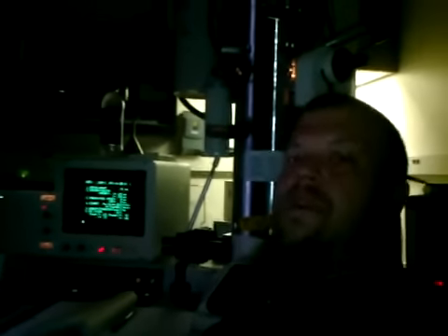So I thought I'd show people some of what it looks like for me at the other place. I am sitting in front of an electron microscope. This is a transmission electron microscope, and I'm using it to analyze currently a piece of manganese for a standard. But you can see our computers here. This is the scope.